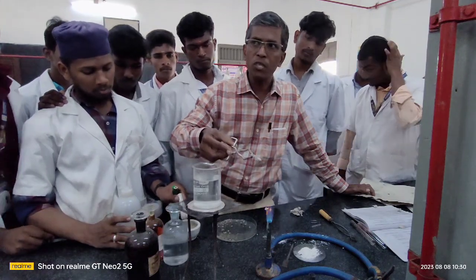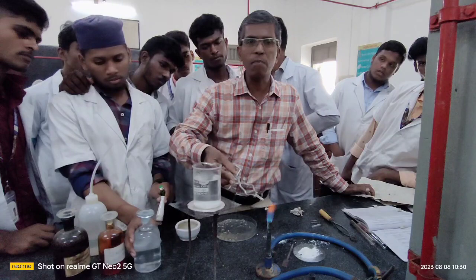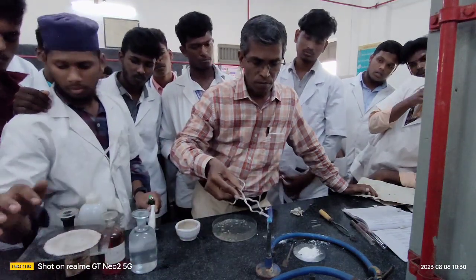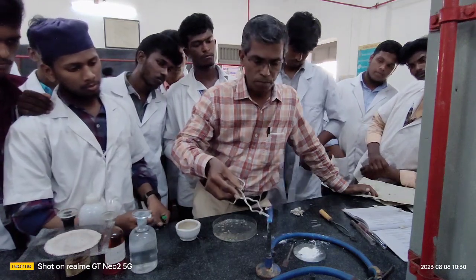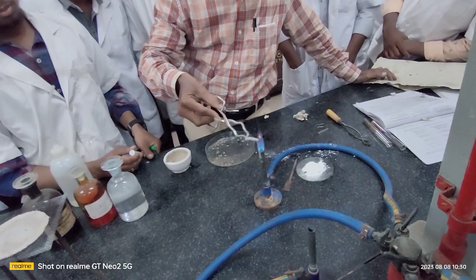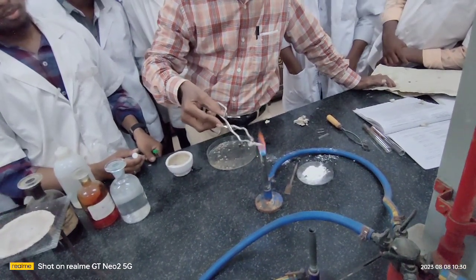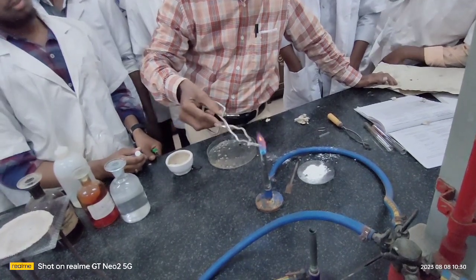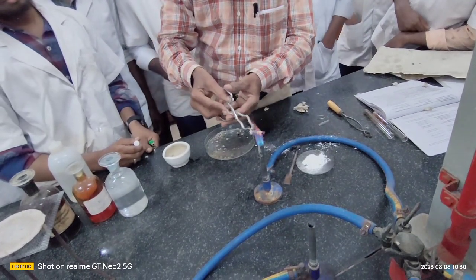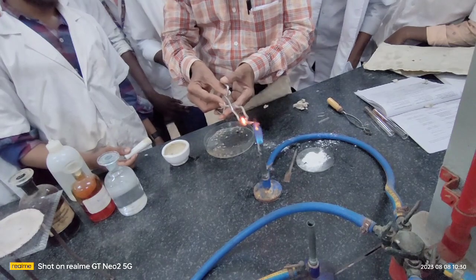Try to heat this fusion tube gently in the first step, and once you know the process of melting of the organic compound has taken place, you heat this strongly so that the fusion tube changes completely into red hot. See how I am dealing with this particular preparation. Now the fusion tube is almost red hot. Now plunge this into the water.